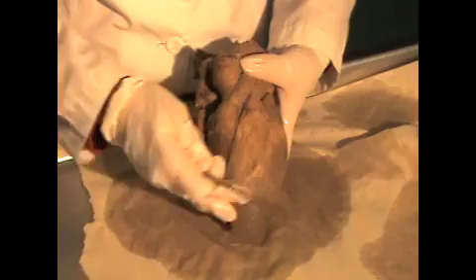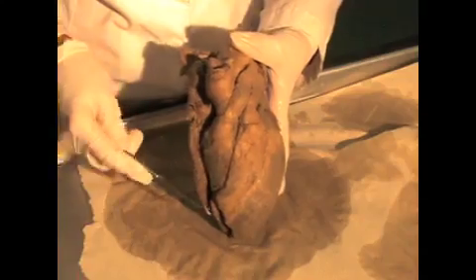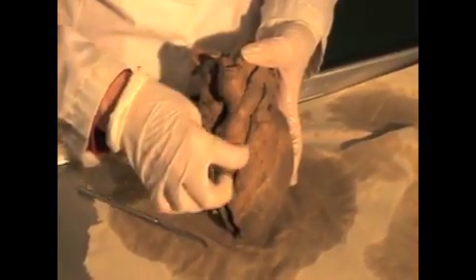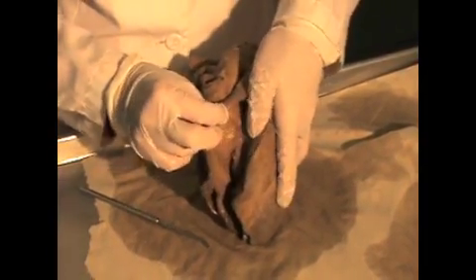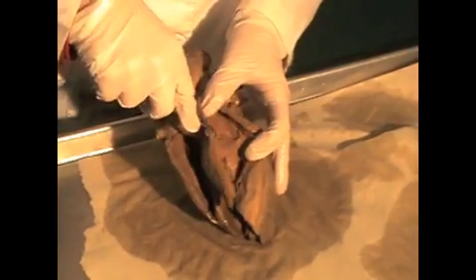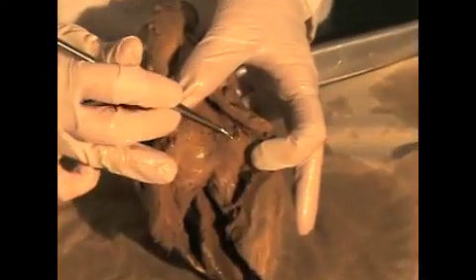All right, the final feature associated with the right side of the heart is going to be the pulmonary trunk and the pulmonary semilunar valve. So as you're looking at the surface of the heart here, remember that the right ventricle lies over here, and it's pushing blood up into that pulmonary trunk, and this pulmonary trunk has been opened up, and a portion of the right ventricle has also been opened up. So I'm going to open this, and I see at the base of the pulmonary trunk there are these little pockets right here. These little pockets are the pulmonary semilunar valves.